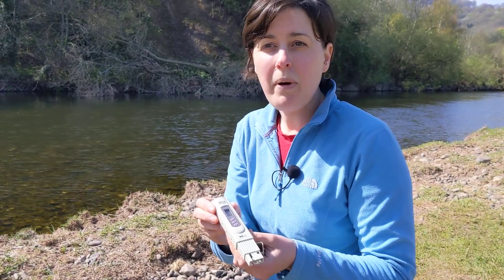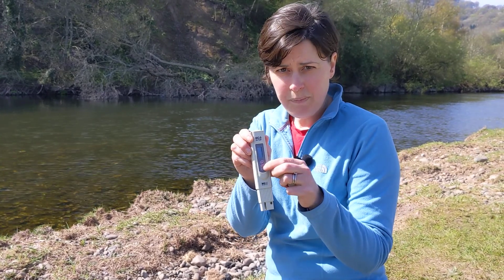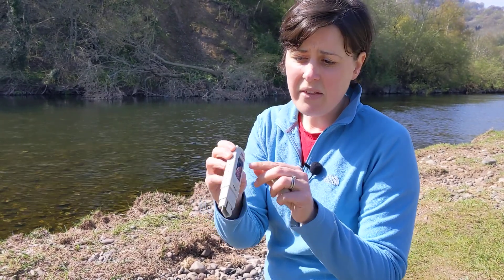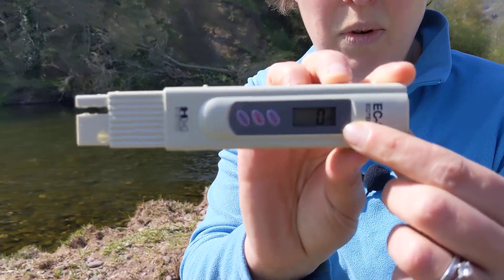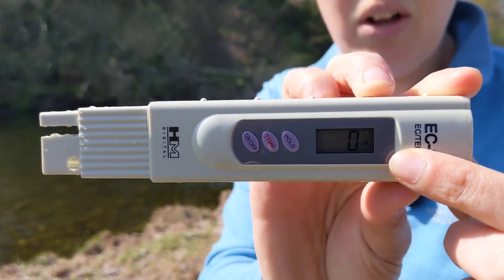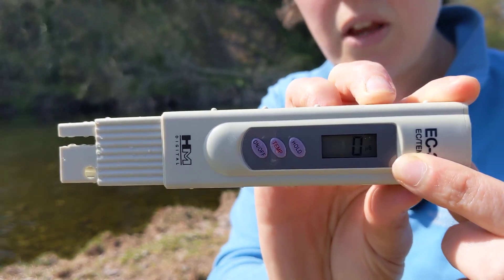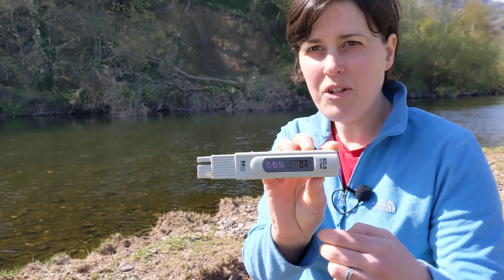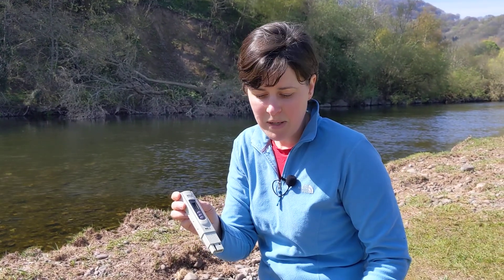It's measured in a unit called microsiemens per centimetre. When you turn your meter on, check that the little window says zero microsiemens — you'll see that as a mu symbol, a little u with a tail on it. That tells us we're in the correct unit for measuring conductivity. Your meter may also measure in ppm or milligrams per litre as a measure of total dissolved solids, but these EC3 meters measure in microsiemens per centimetre.